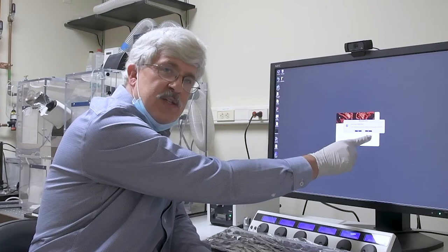If you can, always hit no, do not initialize the stage. So if you're anything like me your brain's going to say no and your finger's going to slip and hit yes anyway. So there's a couple things I want you to check to make sure everything's out of the way just in case the stage does initialize.